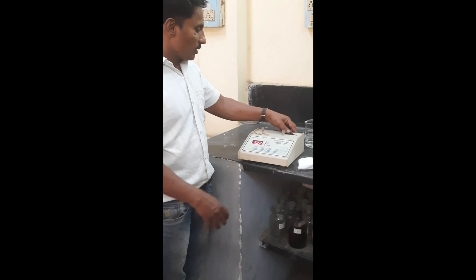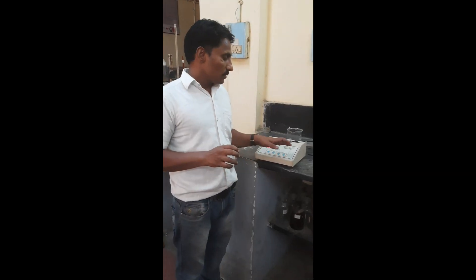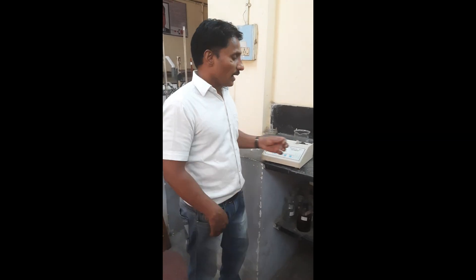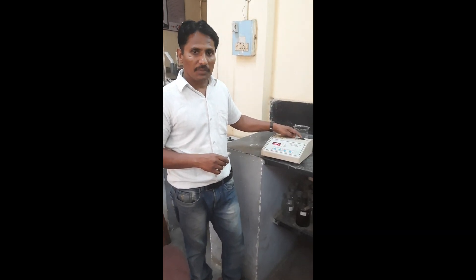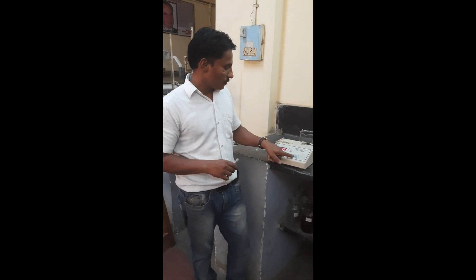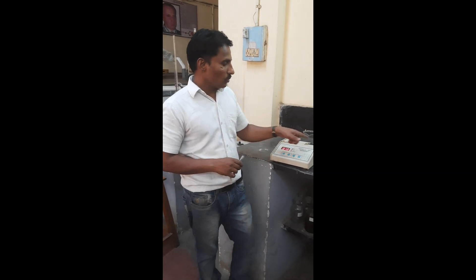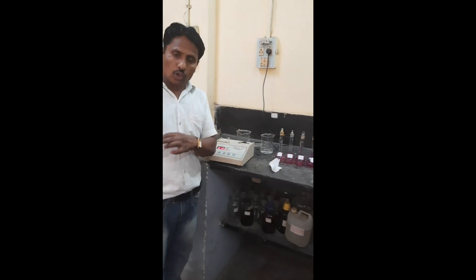Continue through the remaining wavelengths — 400 nm and 500 nm — to determine which is the lambda max. At the lambda max wavelength, calibrate with distilled water to set it to 0, then take readings one by one, starting with the 2 ppm solution.